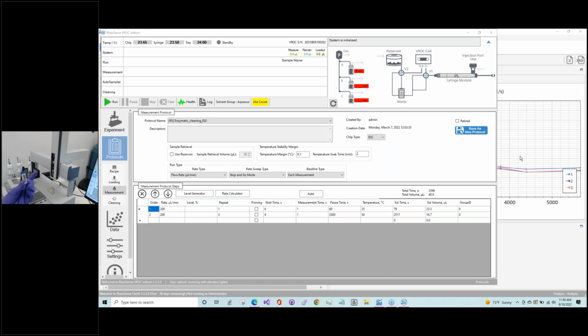So this is a Waters vial. This is what we use now. Unlike the old ones, this is just a single piece. The tapering is built into the shape of the base of the vial, as opposed to having to put an insert in there. We adopted these for a couple of reasons. One of them is they're very common with our customers for a lot of their other analytical techniques, so it was convenient for them to just use the same vial for this instrument as they would for their others.